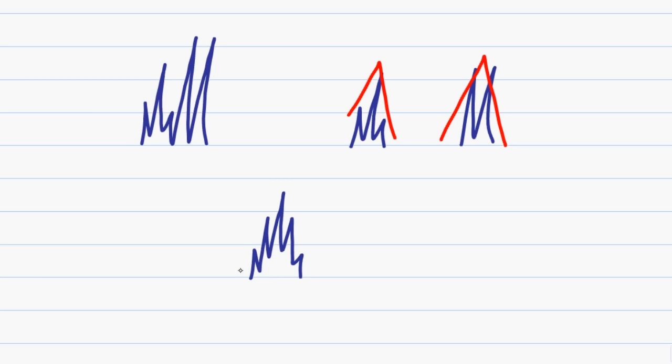However, going back to my original peak, if I try to do the hat trick, notice that I have this peak right here that does not fit, and so I know that is incorrect. However, notice I can draw 2 separate hats, or 2 separate triangles, and this shows me that these are actually 2 peaks that are overlapping on the graph.